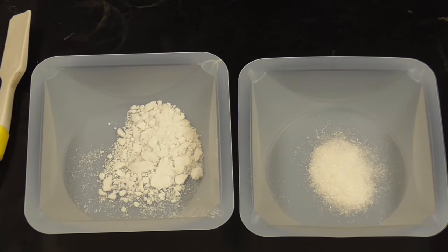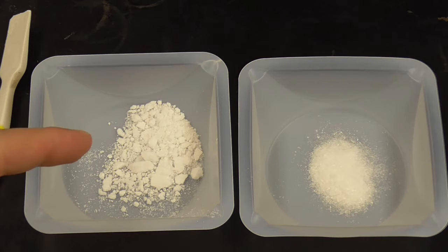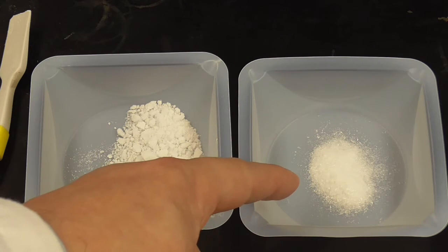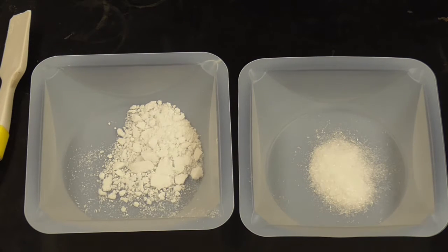Okay, so before we start doing some of the characterization tests, I just wanted to do a simple physical comparison of the two things. So the crude is over here on the left. This is the crude aspirin, the stuff that we didn't purify. And then this is the purified aspirin over here on your right. Okay, so this will give you a chance so that you can do some observations on the differences between them.